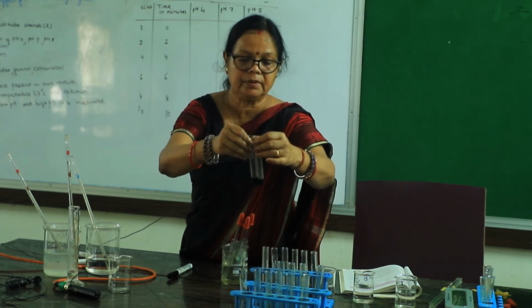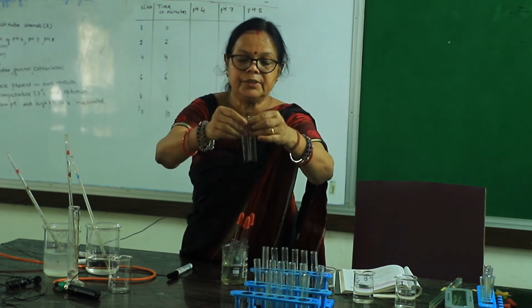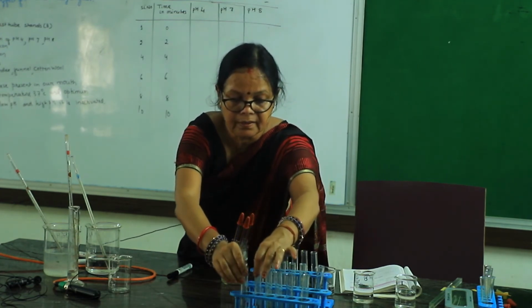This is pH 4, it turns blue black color, and this is pH 7, also blue black color.